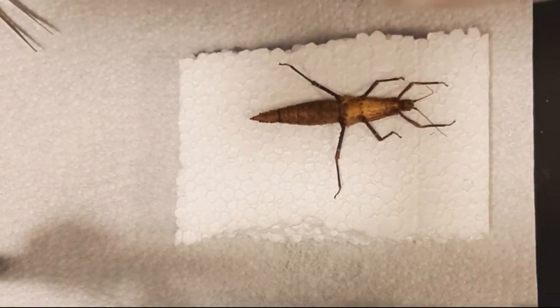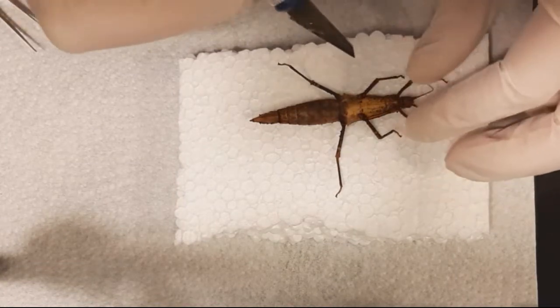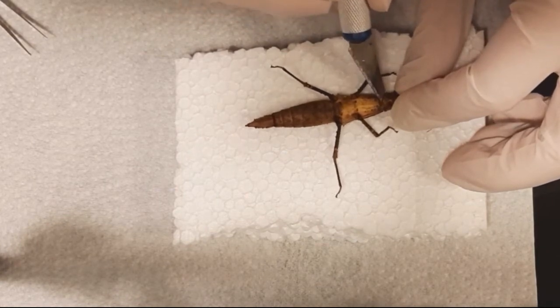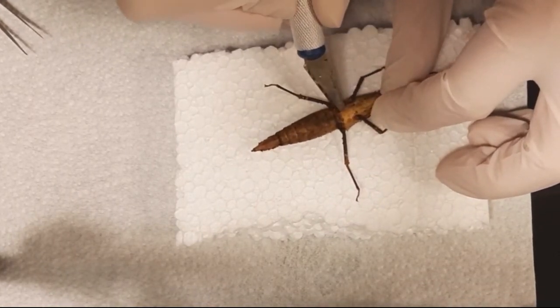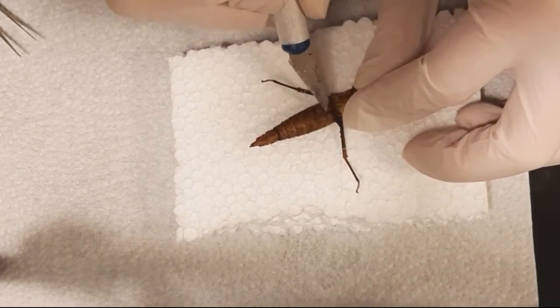What I will do here is not that pretty but it's definitely an efficient method — a new method that I applied. It will leave a bigger mark on your insect, but basically what you do is cut the insect open in the middle. You can also do this on the side so that you fold it open like a box, but that will make it a bit more difficult and a little more advanced.